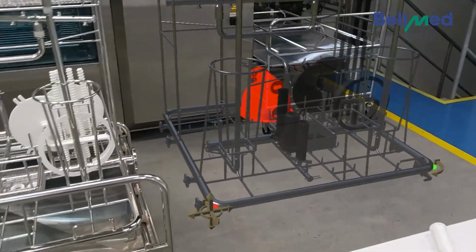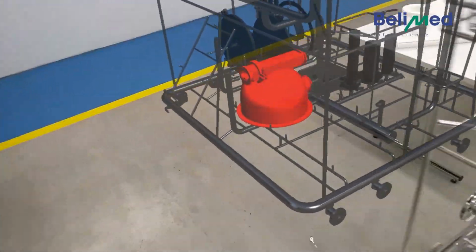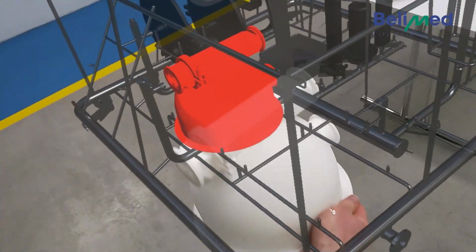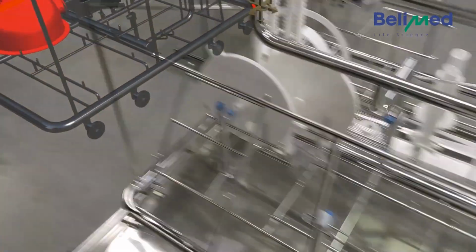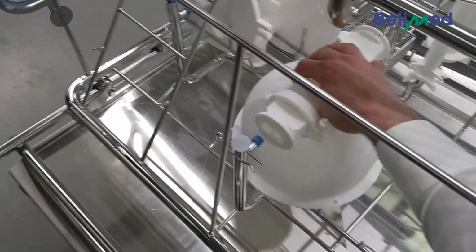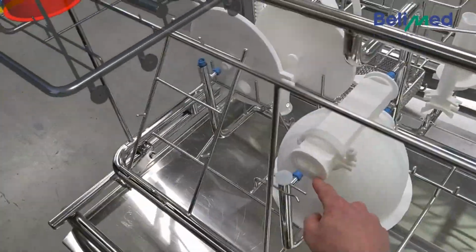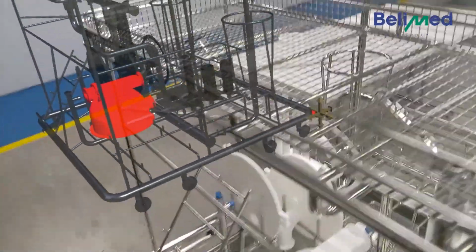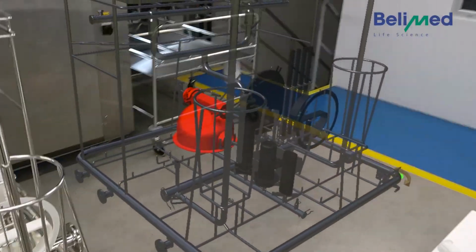So the next part is this big part here. So we're just checking where it needs to get. So it will be positioned like this. So exactly here, we have again all nozzles aligned to the openings. So we continue by saying check.